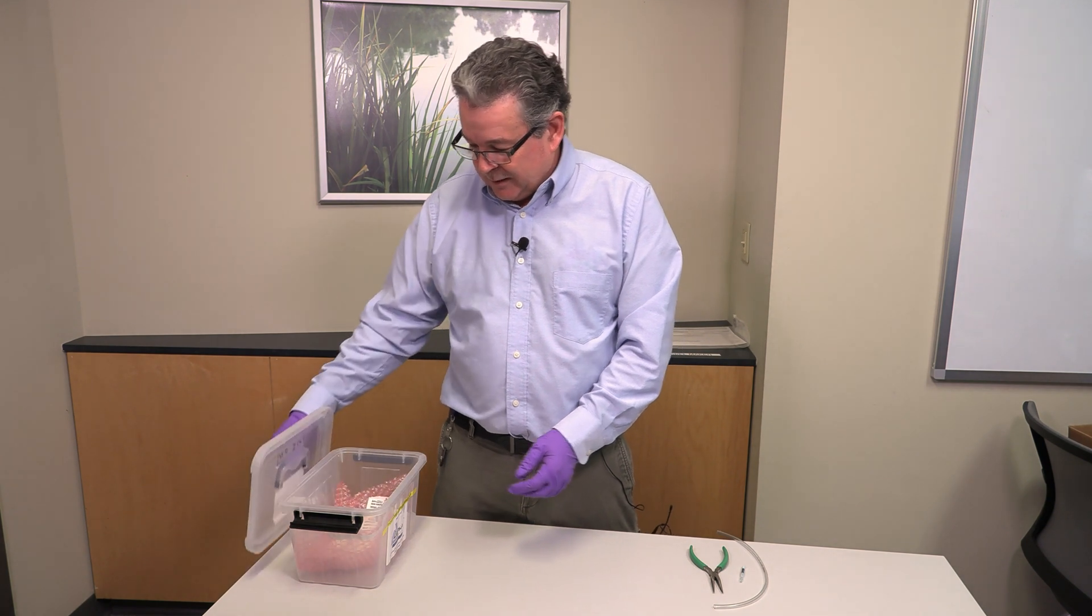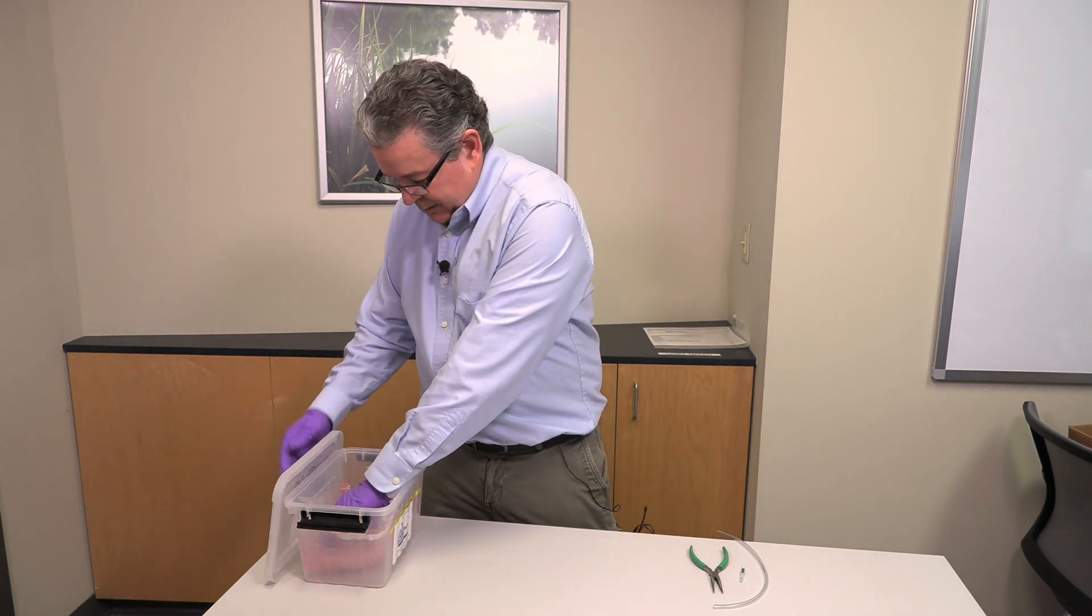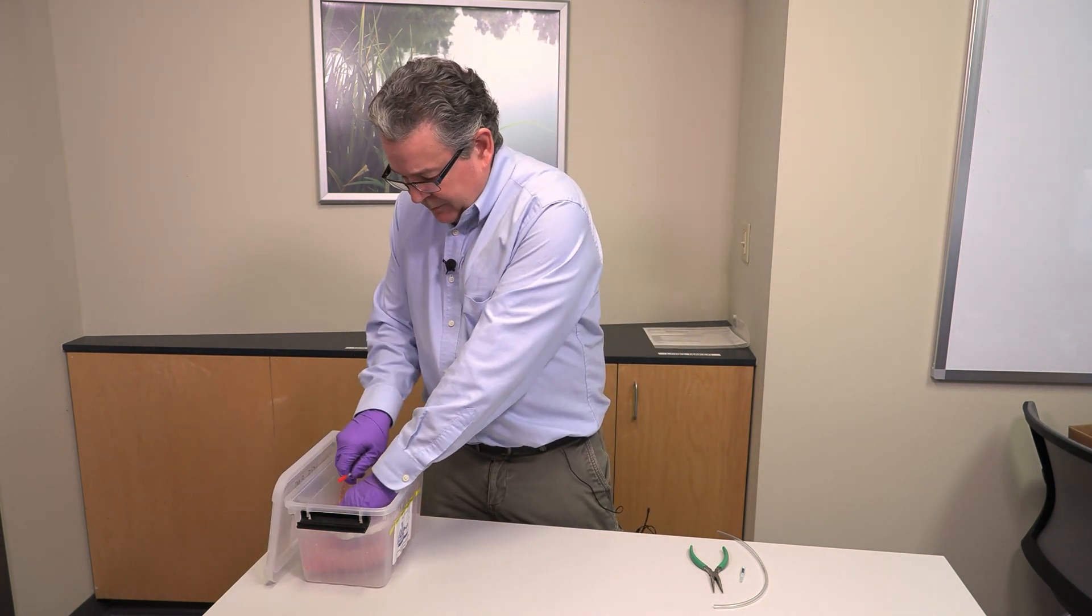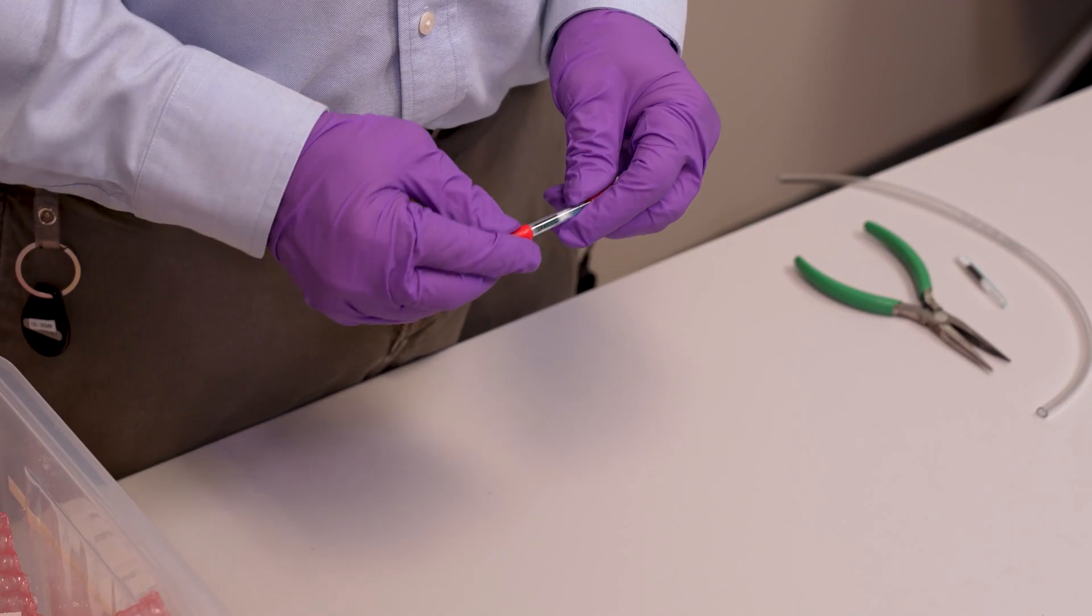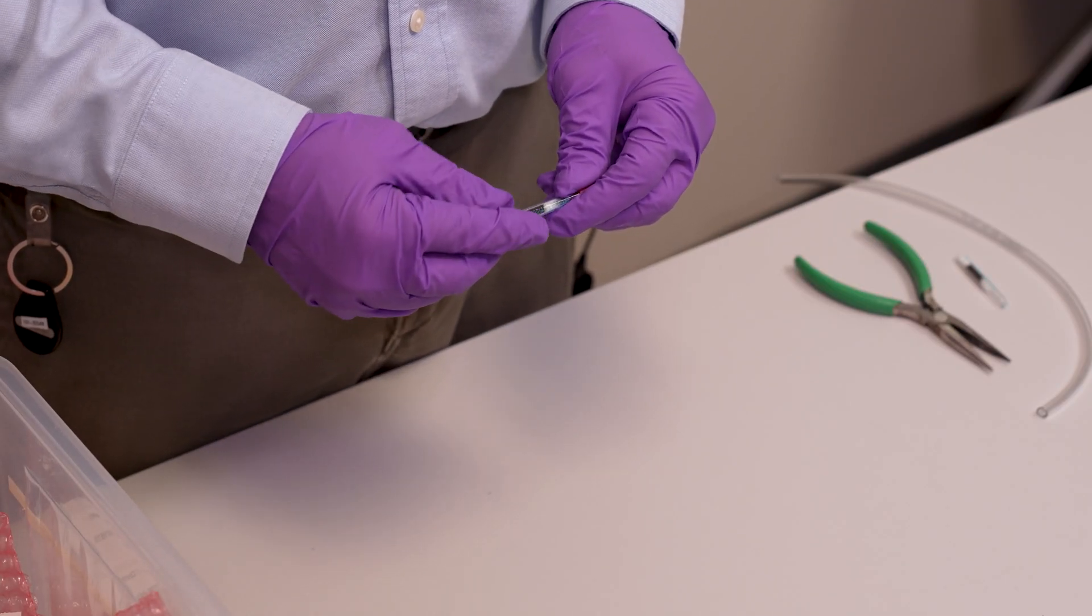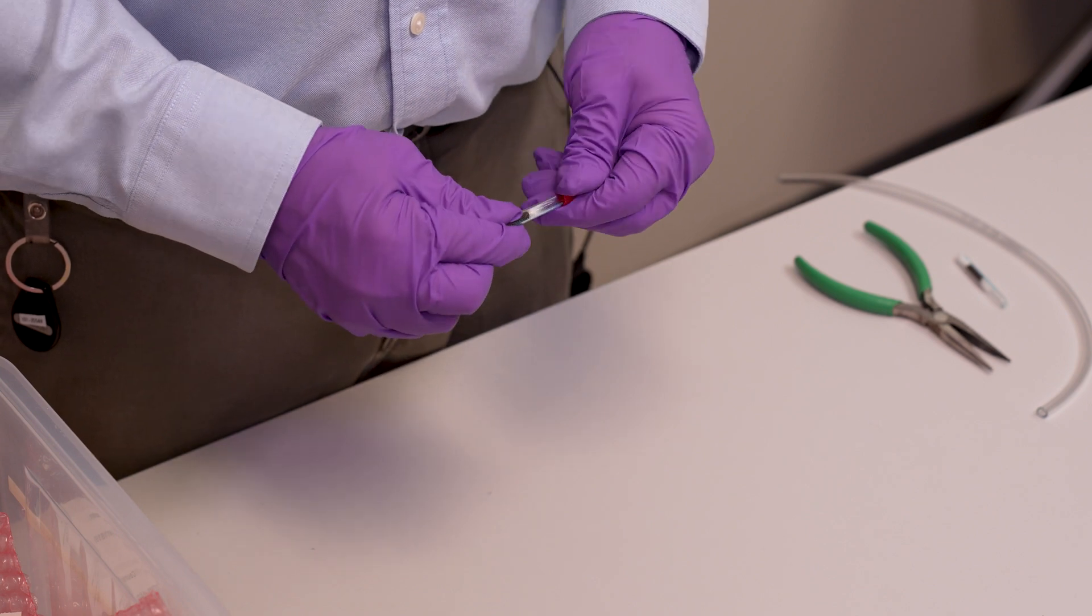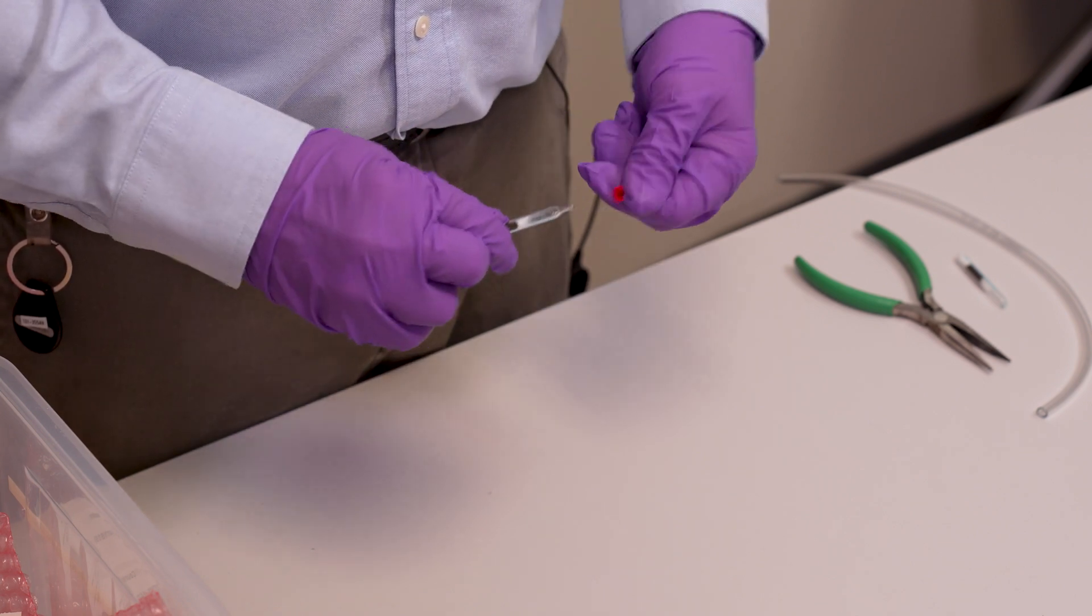The tubes will come in this plastic container from the laboratory and you'll want to take out your tube. It comes with plastic end caps to protect the tube on the return trip to the laboratory. You want to remove those plastic end caps.